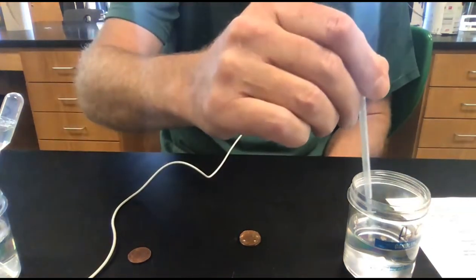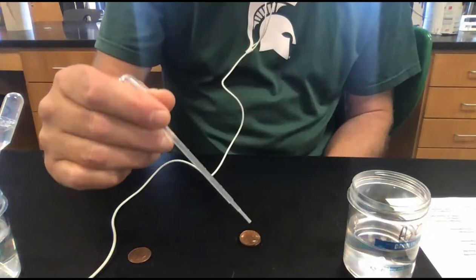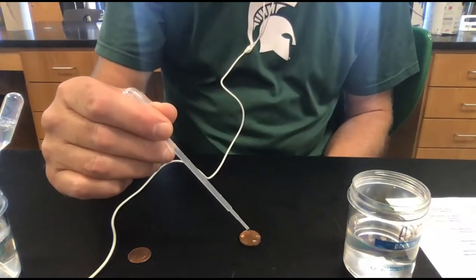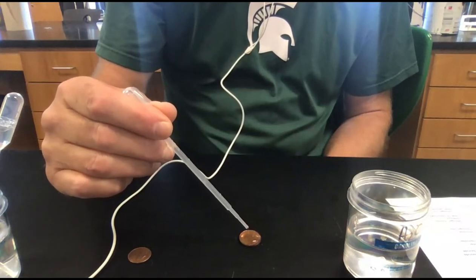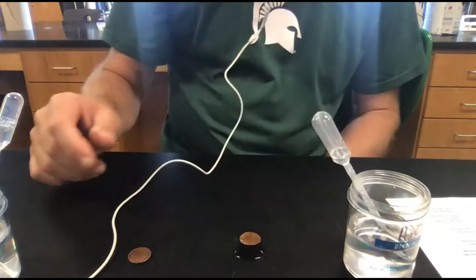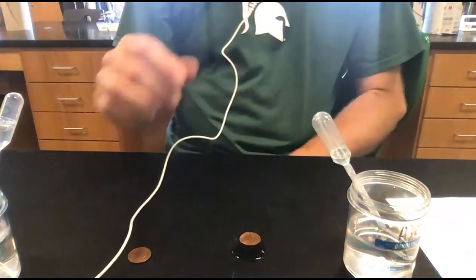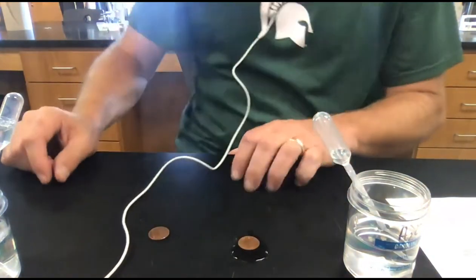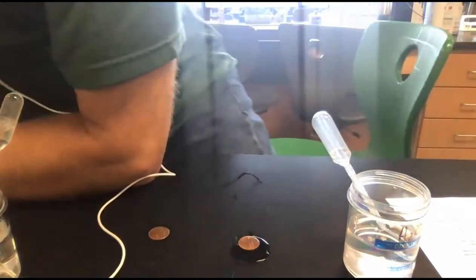That wasn't really 27. There was nothing that came out. This will be 27, 28, 29, 30, 31, 32, 33, 34. 34 is where it broke. And I'm supposed to do that 3 times. All right, so that first time took 34.